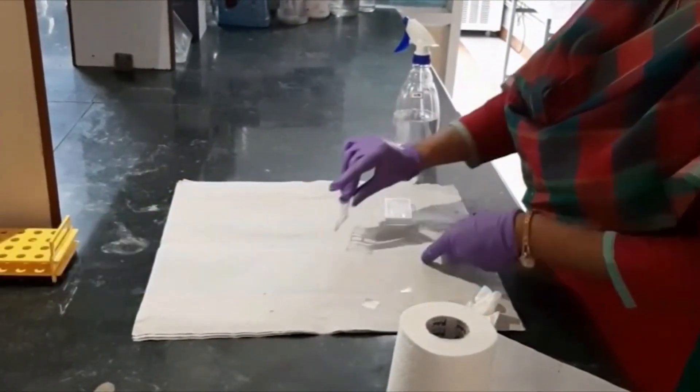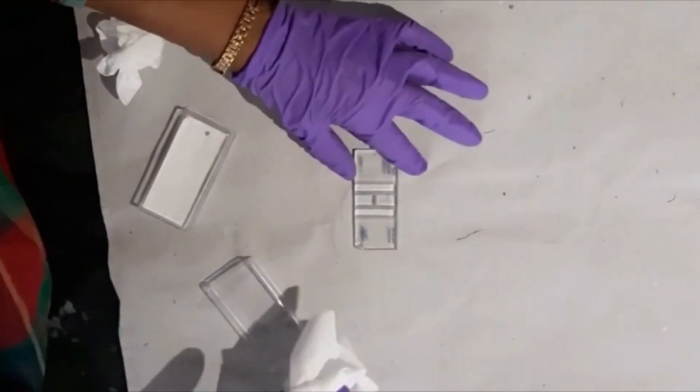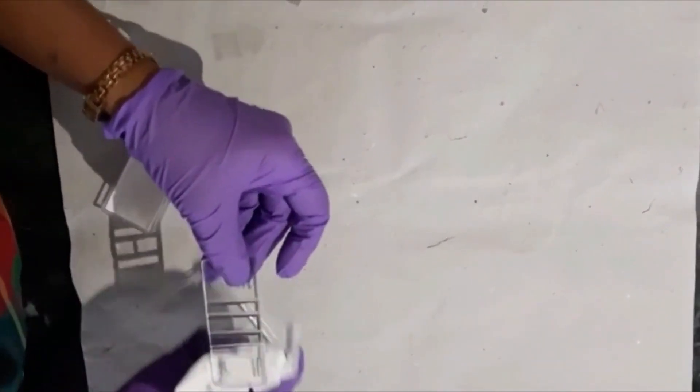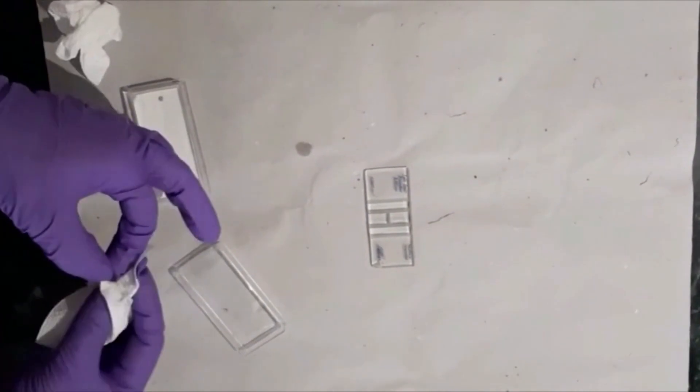Meanwhile, clean the hemocytometer by wiping it with ethanol using tissue paper to ensure it is free of dirt and contaminants. Also take the coverslip, wipe it with ethanol, and place it over the hemocytometer.